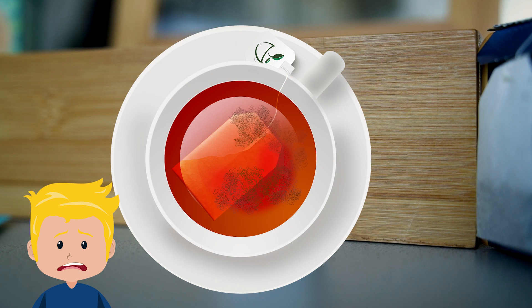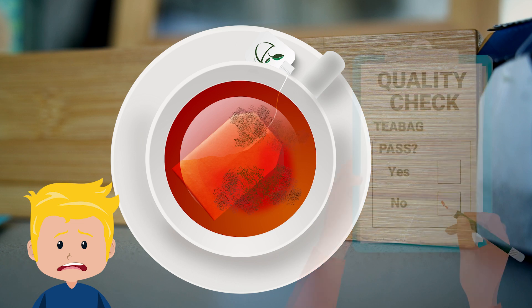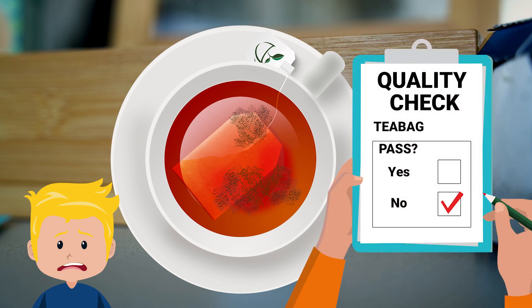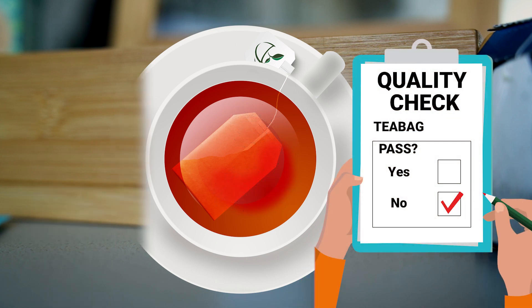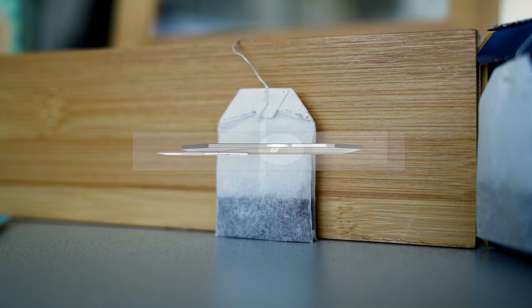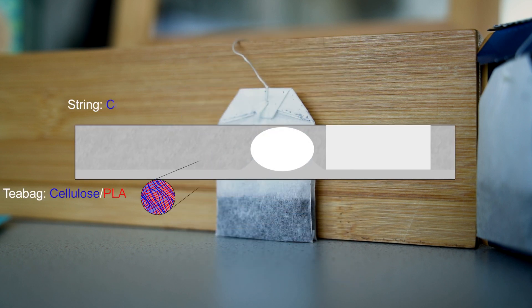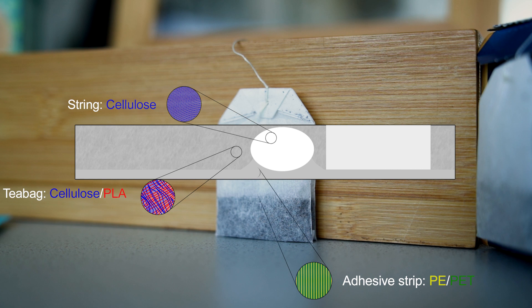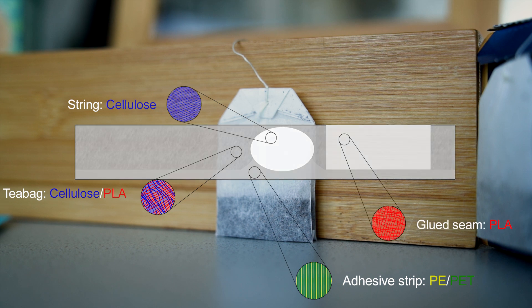To prevent this from happening, the quality of the adhesive seal must be checked regularly, for example using FTIR microscopy. With it, we can quickly and easily determine whether the necessary components for optimal bonding are present and correctly distributed.